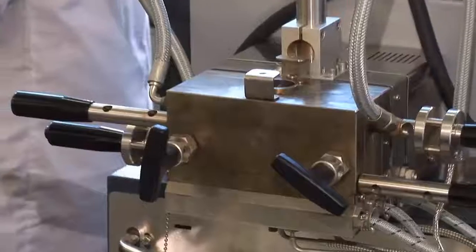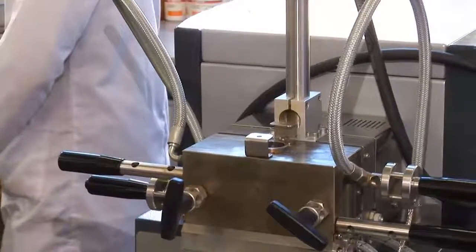Now in this particular lab, this is where we do the preparation of polymer nanocomposite. What this machine allows us to do is to mix polymer with a filler, and a good example will be to prepare a biodegradable polymer which could be used for packaging. This would assist us in ensuring that we've got modern materials that are biodegradable and that will be friendly to our very own environment.